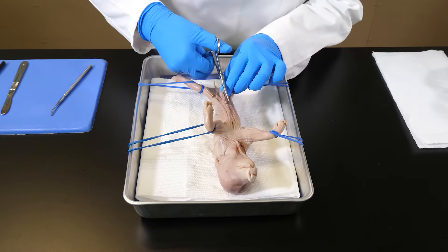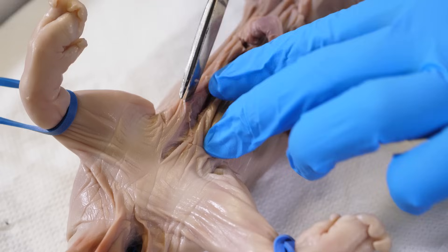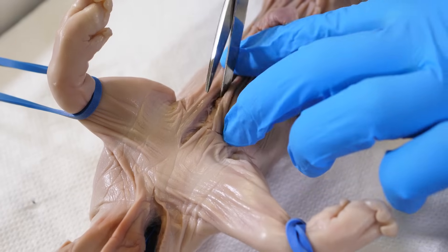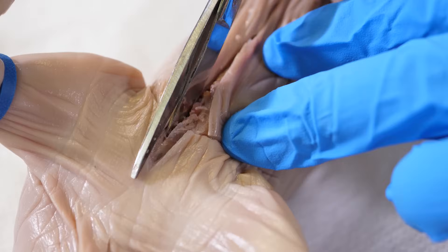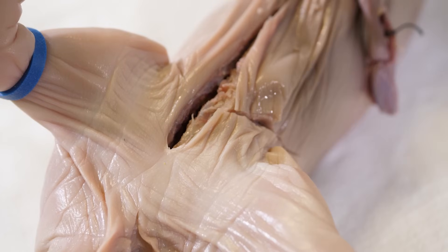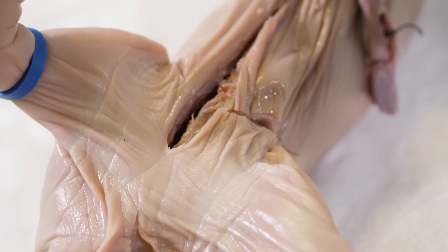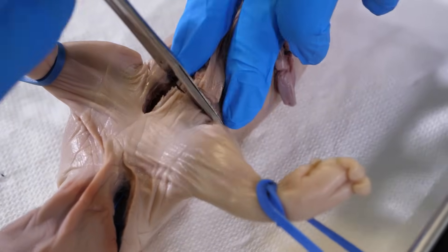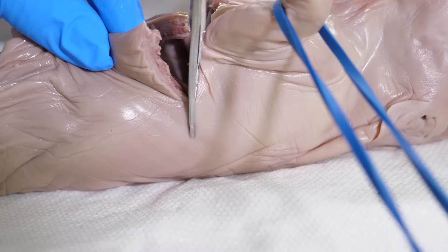With the blunt scissors, we follow our previous incisions to cut through the muscle layers. As we cut toward the sternum, we pull up on the incised skin to keep it away from the internal organs. Next, we cut up through the sternum and ribs near the anterior end of the medial incision. Since the fetal pig skeleton is mostly cartilaginous, we can cut through it with scissors. We follow the transverse incisions near the forelegs and cut through the muscle layers with the blunt scissors, and also cut through more ribs.